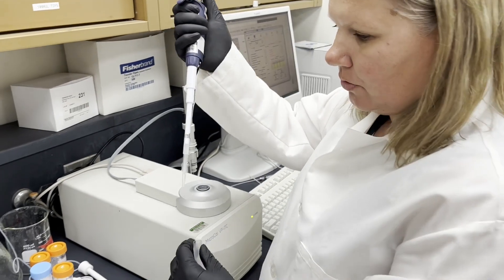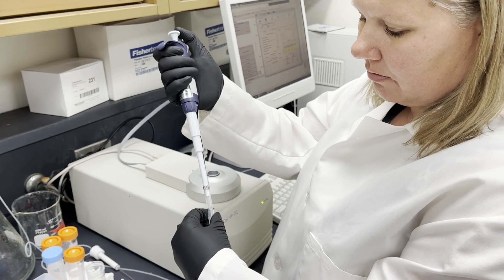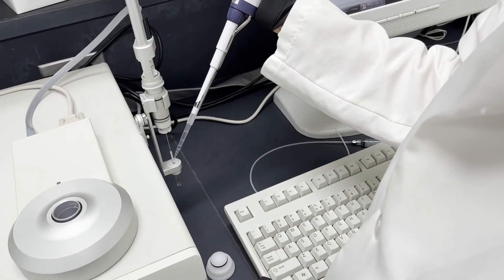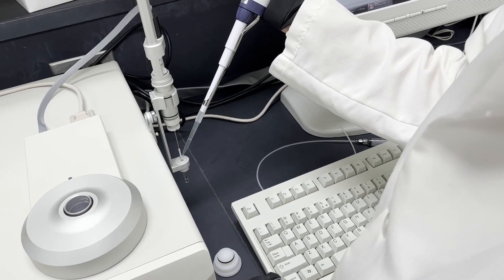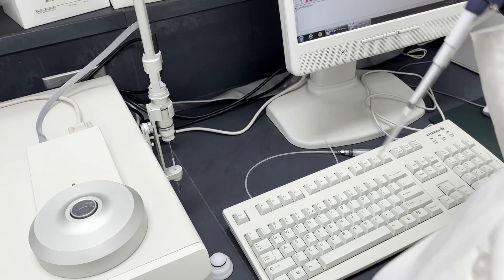Then you can put your ligand that you want to titrate into the injection syringe.